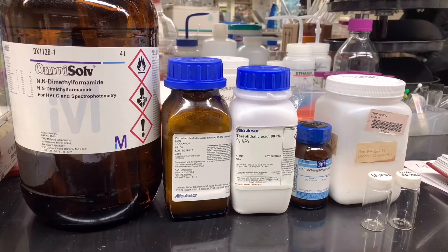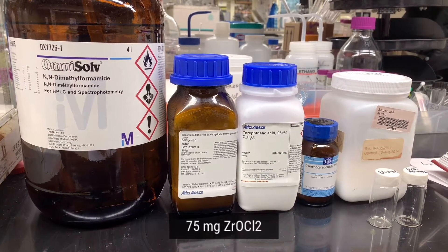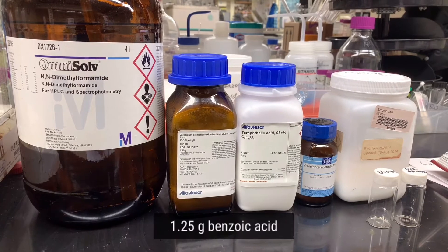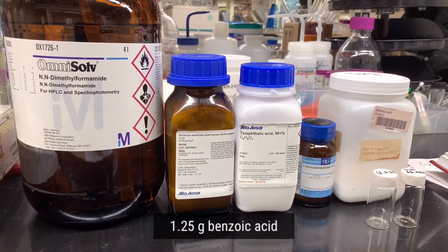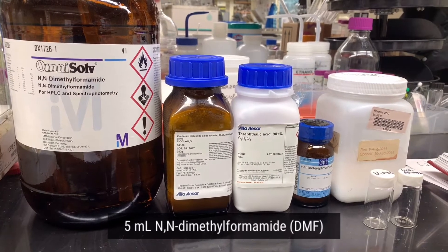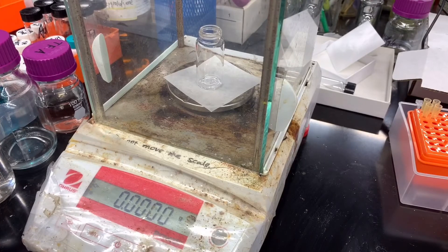For the amount of chemicals, we will use 75 milligrams of zirconium dichloride oxide, 15 milligrams of BDC ligand, and 1.25 grams of benzoic acid. All the chemicals will be dissolved in 5 milliliters of DMF and heated at 120 degrees Celsius for one day.